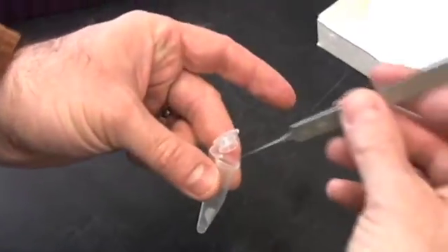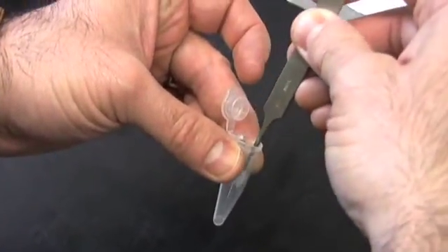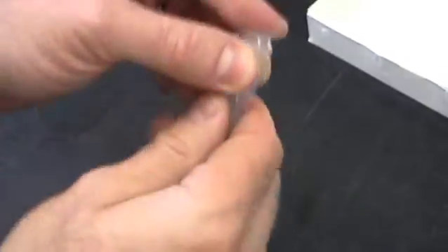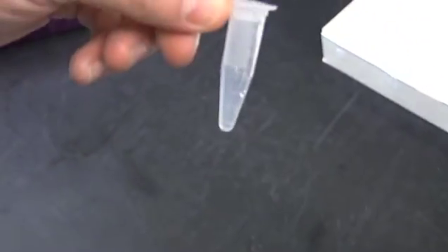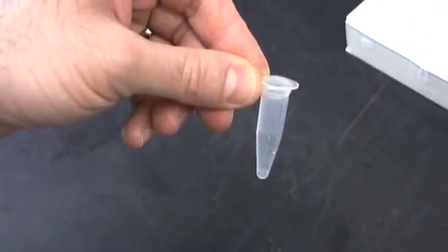You're ready to take the filter paper out and you can discard this and the resulting solution contains your DNA and is ready for transformation.